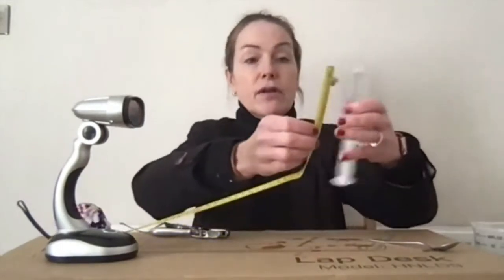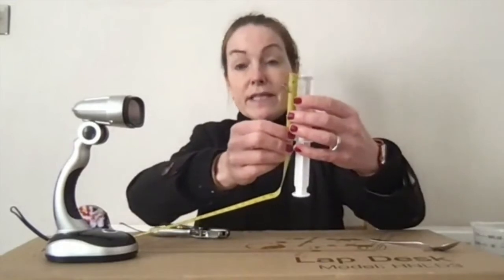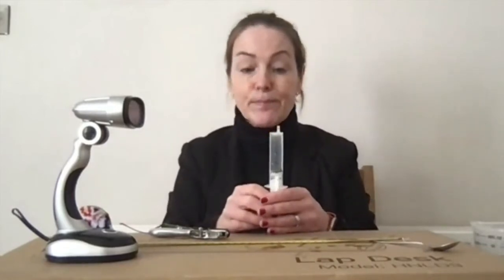So you can either use 1 over time to plot it, or we can do the distance that they've actually moved. So this is 6.5 centimetres, so they will be moving 6.5 centimetres in a certain time. And so therefore we can work out rates of centimetres per minute or second. And we can plot that against the lux.